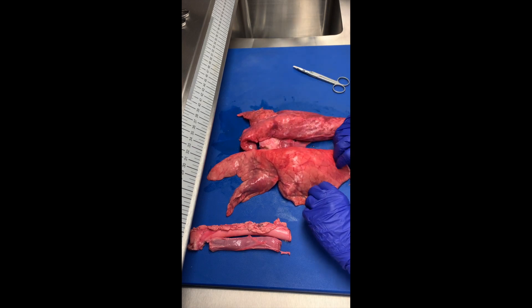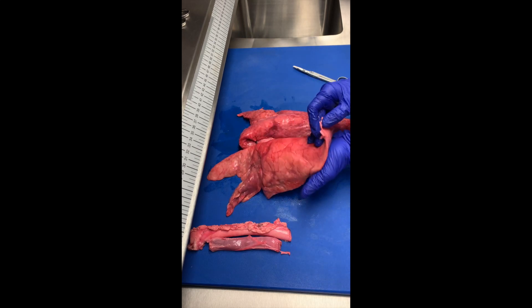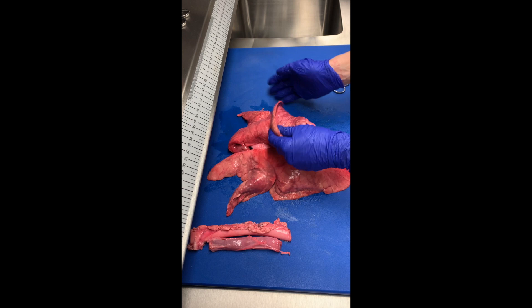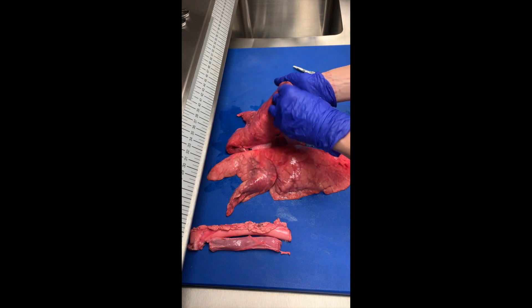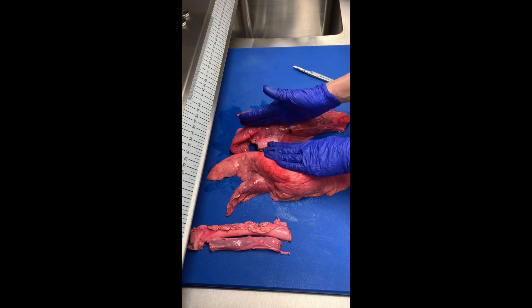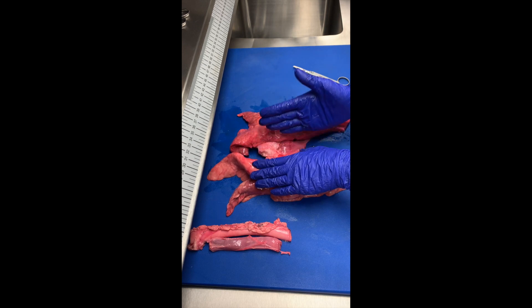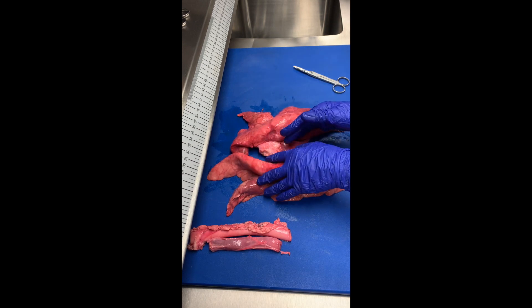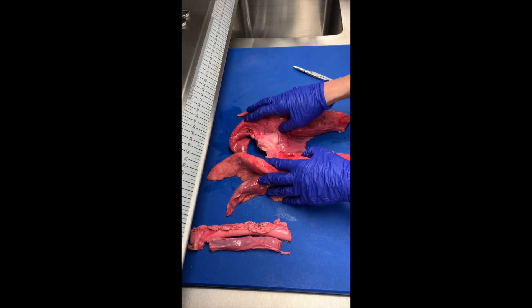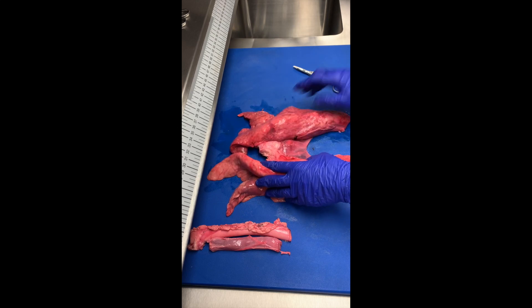If I flip up this caudal surface, what you're seeing here is the diaphragmatic surface of your lung. Then once I cut away the primary bronchus from the hilum, we will be able to visualize the mediastinal surface of the lung.